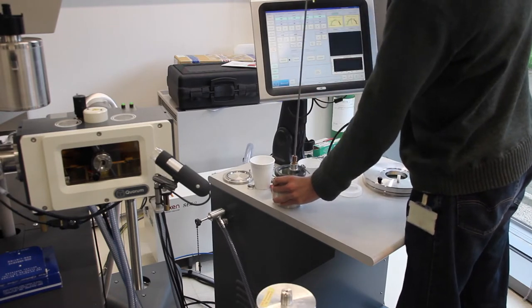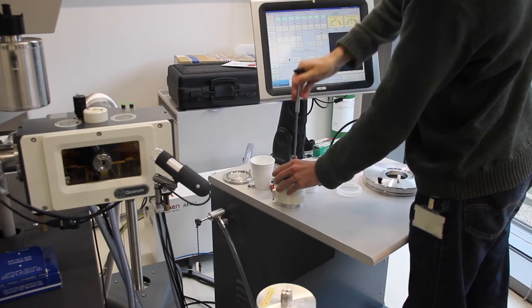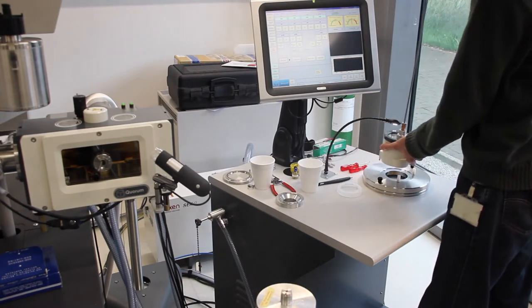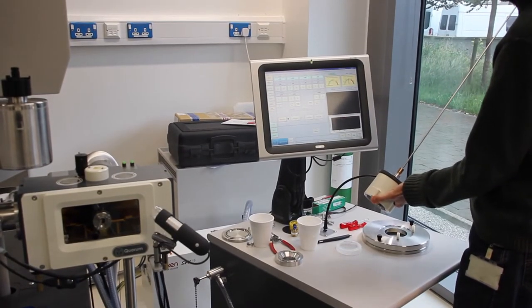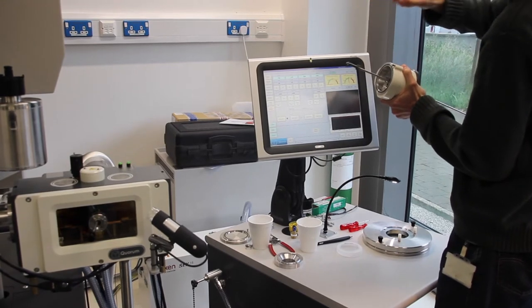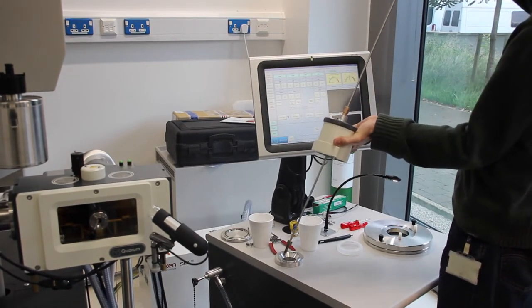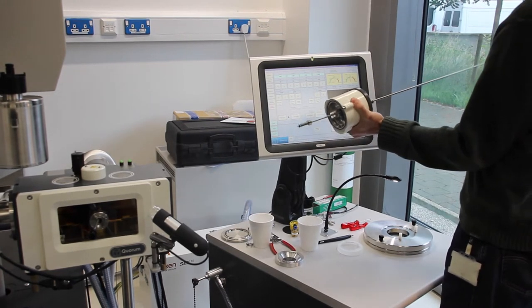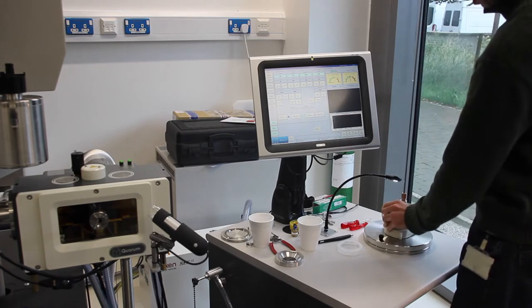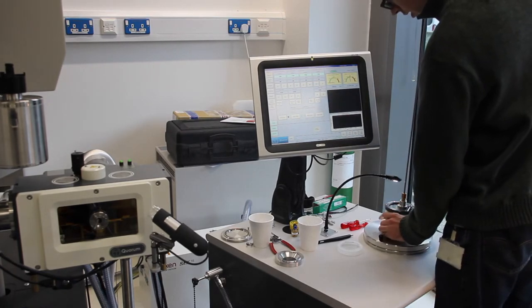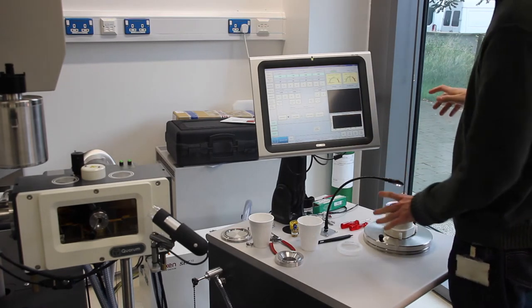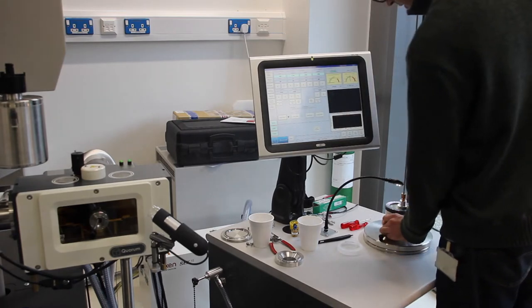Now we're going to need to get our rod for attaching onto the shuttle. Make sure that you grease this up with the provided oil here, so that this is easy to put into the prep stage and the FIB stage. We'll take this, line up this rod to this top wall here, and also it's good to check that the two ends here, these two nodules that will hold the shuttle in place, make sure that they line up with the wings on this wing nut at the end here. They should do that. Now we'll put this in, put this on top so that this is nice and flush, and the first thing we're going to want to do is cool the rod on the side there. I've inserted the rod into the liquid nitrogen next to the shuttle.